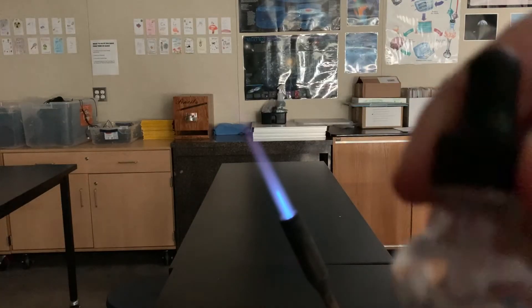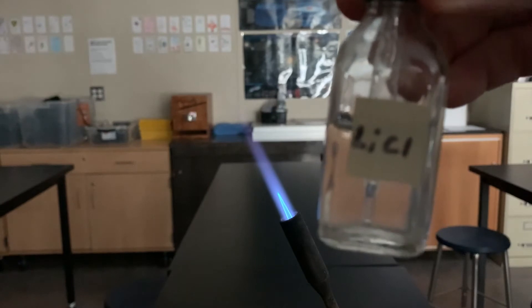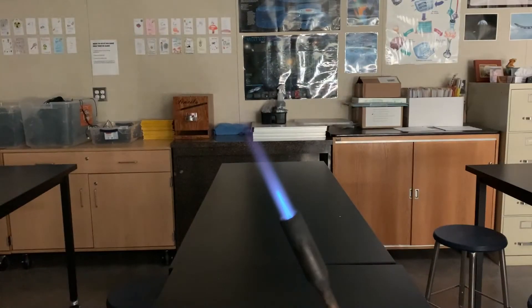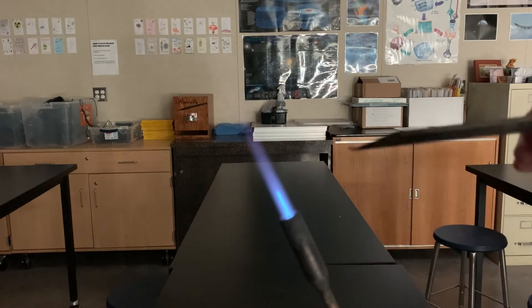This next one is lithium chloride. Lithium chloride is a clear liquid, but it is one of my favorites in flame tests.